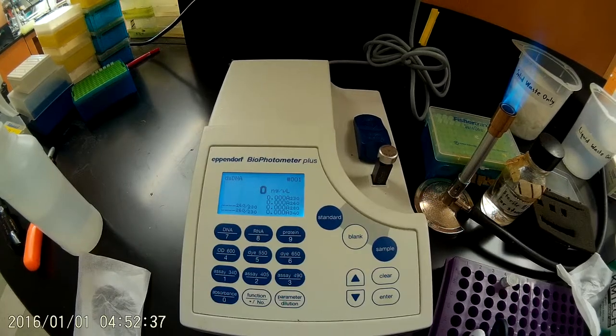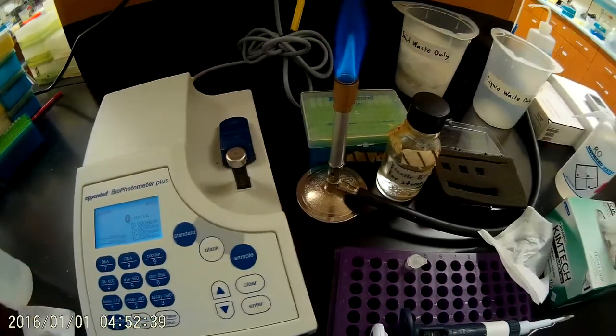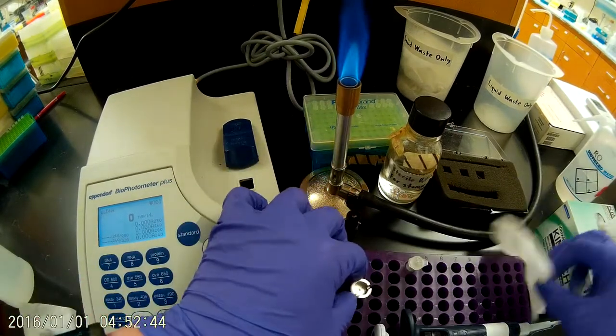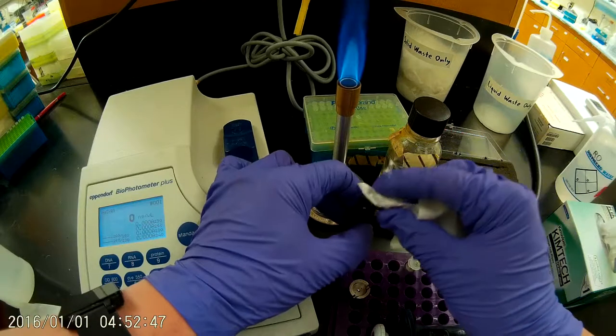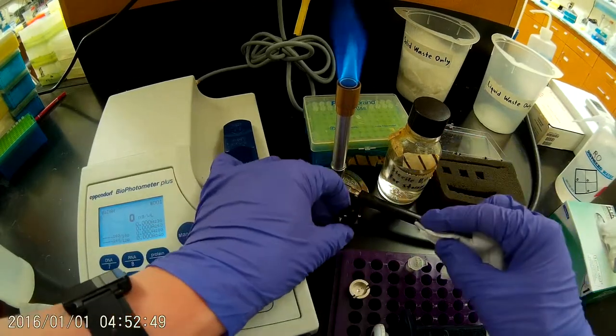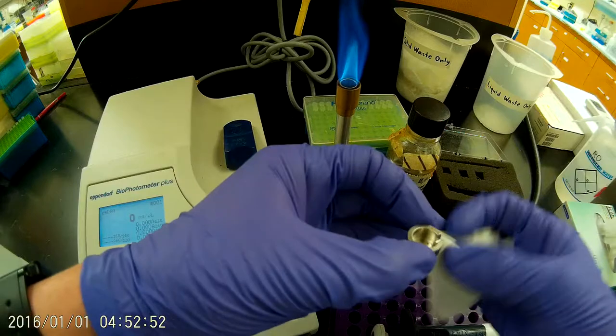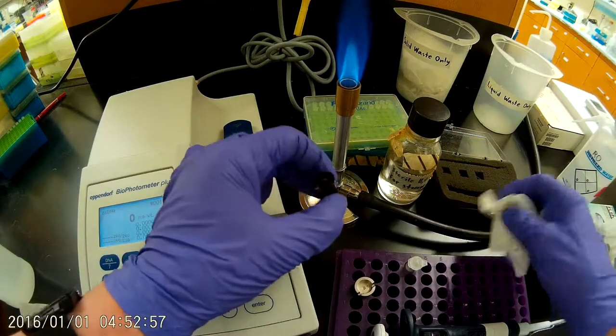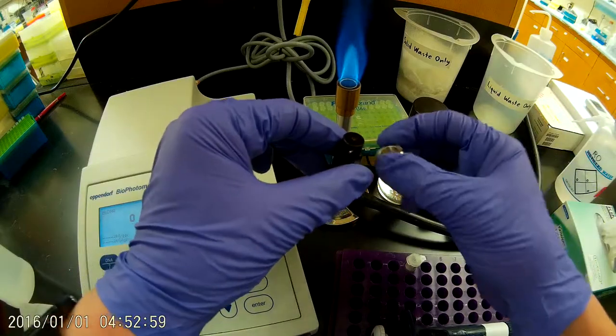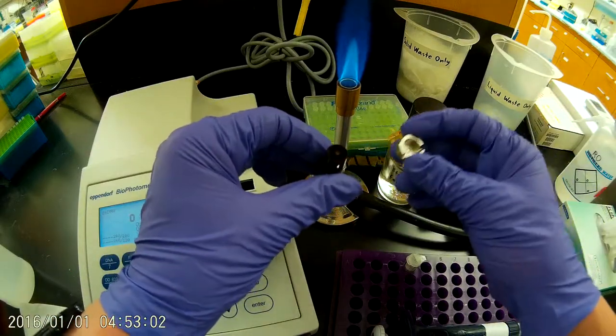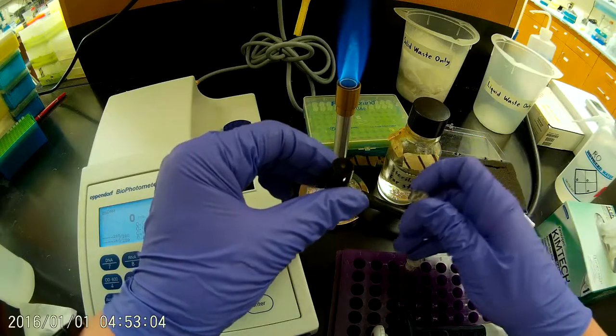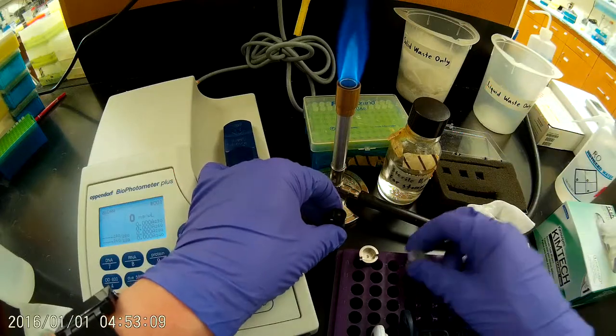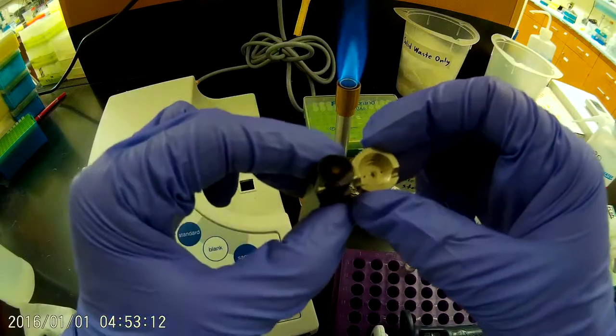Okay, so now we're going to dry off our tray cell and add a DNA sample to the top. So there we are. Just dry off that water very gently. So we always want to be very careful to make sure that there's no dust left behind from the kim wipe. That's another reason for working under the flame here. We want to avoid having any dust settling into our DNA sample or onto the tray, because that can really impact our measurement, and dust contains nucleases, so it can degrade your sample. So these look pretty good.